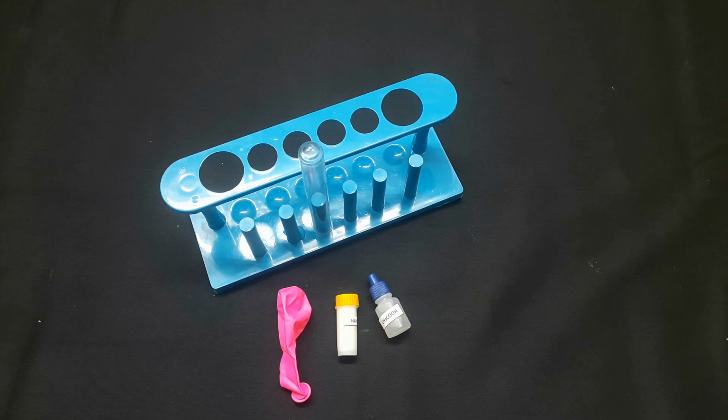In this activity, we will mix the two chemicals, sodium hydrogen carbonate and acetic acid, together. When we mix both chemicals, immediately a chemical reaction takes place. As a result, carbon dioxide gas is released, which we will collect in the balloon. You will also find a white precipitate inside the test tube, called sodium acetate, along with water. You can also find the chemical reaction in the theory section of this activity.